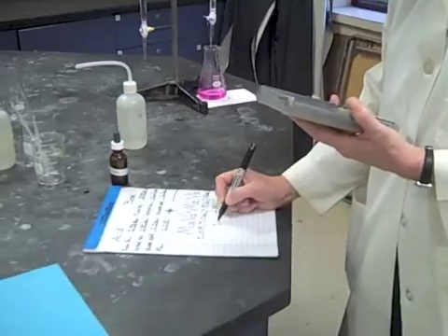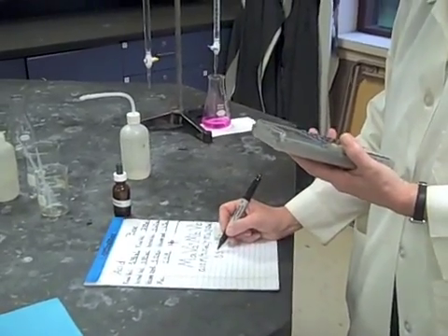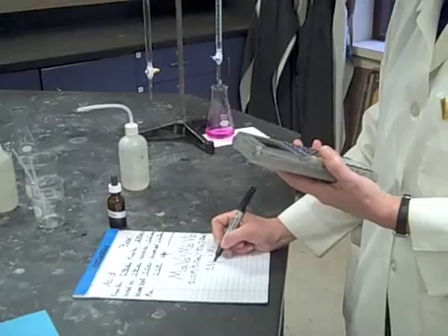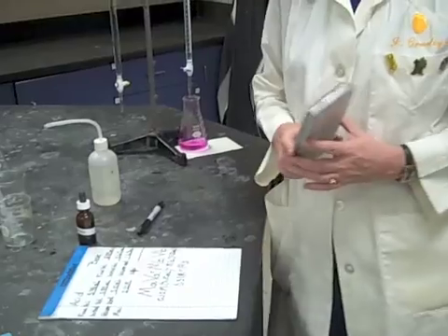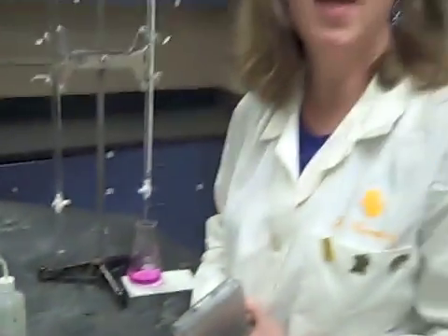And now, the answer is 0.31 molar is the molarity of my base, we think. We're going to go to part three, speed this up, have a better burette, and see how we go on that.